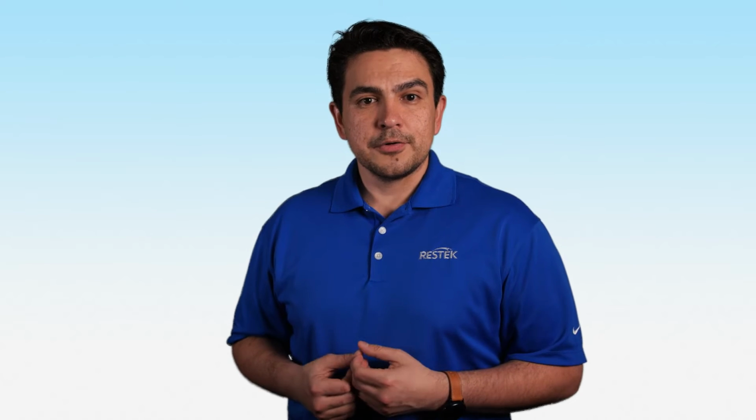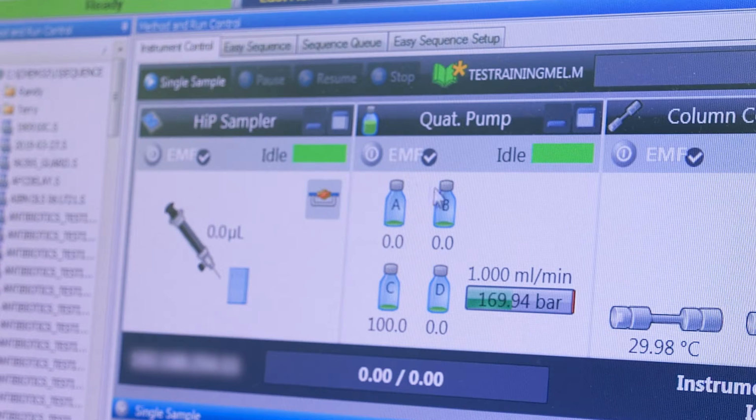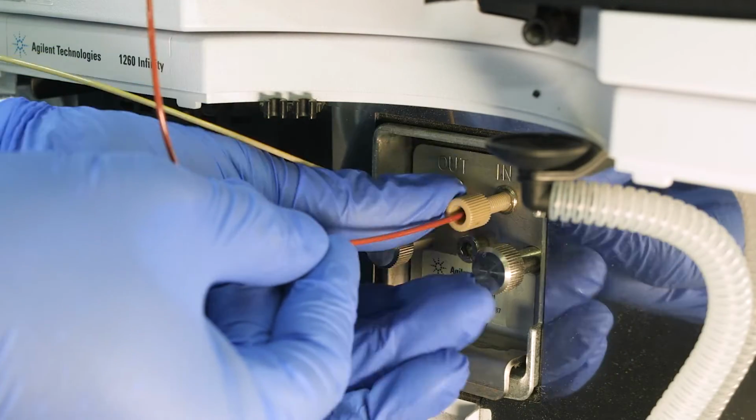Drift, signal noise, or low sensitivity in your chromatogram may be the first sign of a problem with the UV detector. And one of the most common causes is cell leakage. Cell leakage can occur when there is a leak in the tube fitting that connects the column to the cell. We recommend that you stop the flow, push the tubing into the connection firmly, and retighten it. If the leak is still occurring inside the cell, consult your user manual to check if the cell can be repaired with the rebuilding kit or if it requires service.